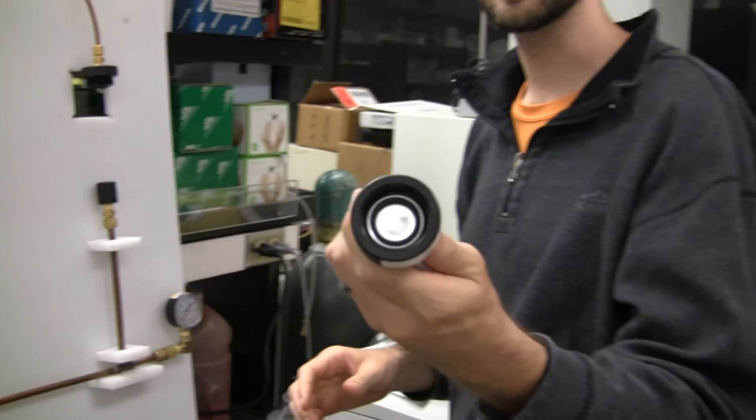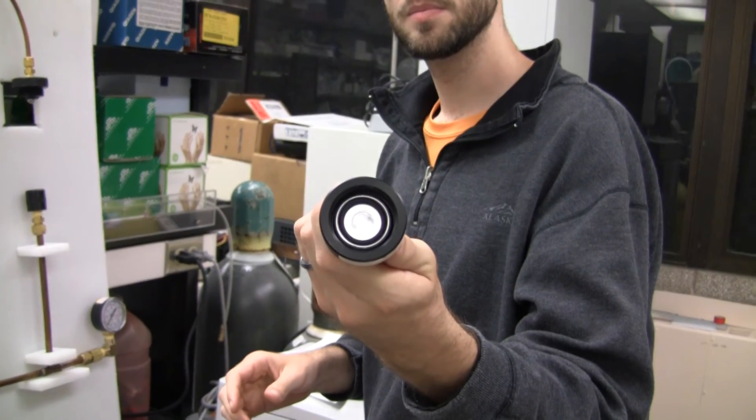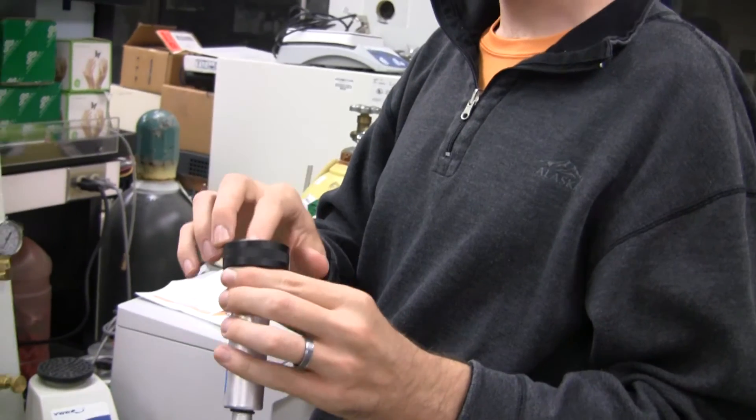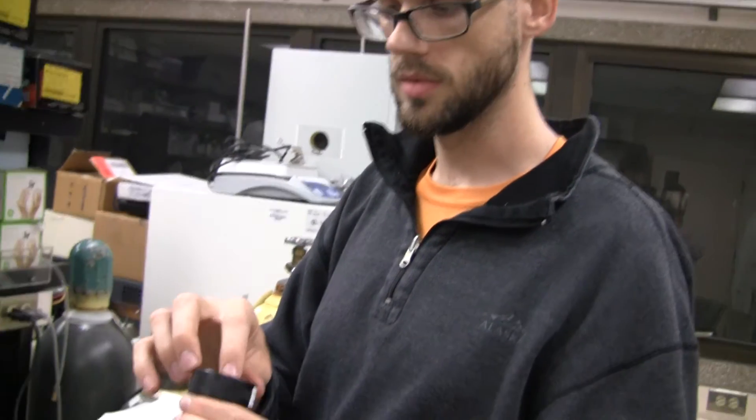Make sure your O-rings look something like this. You will have all the O-rings provided. You don't have to worry about it. Everything is going to be set up.